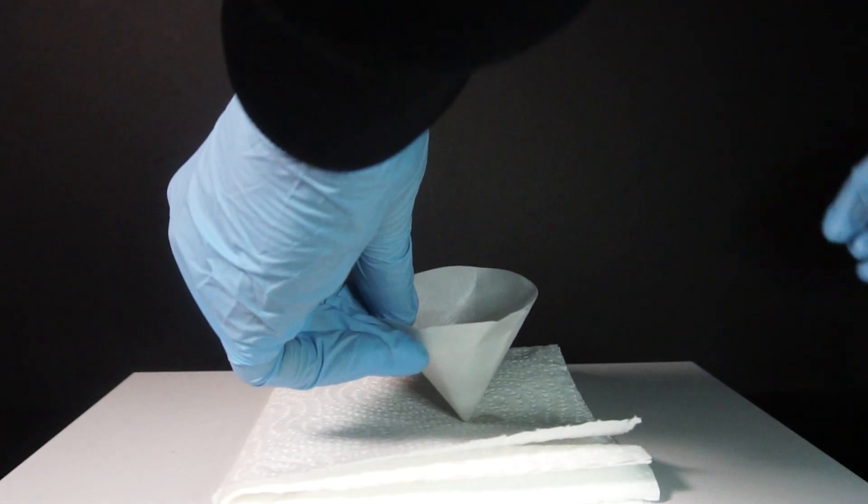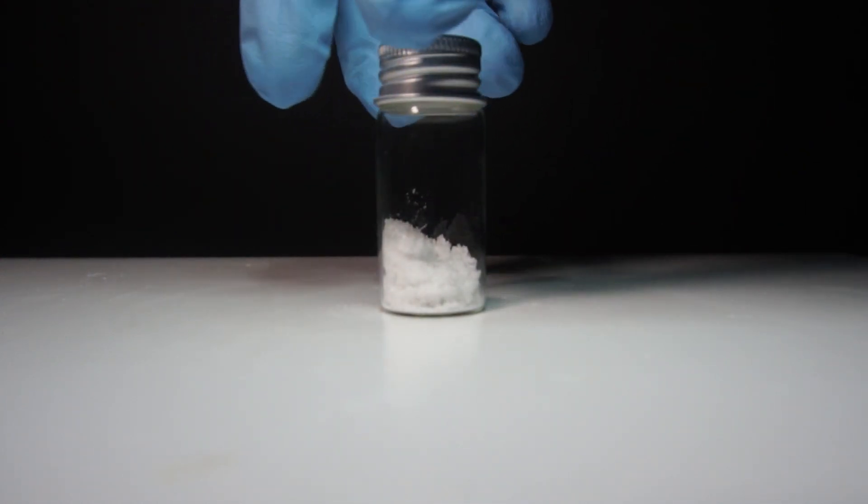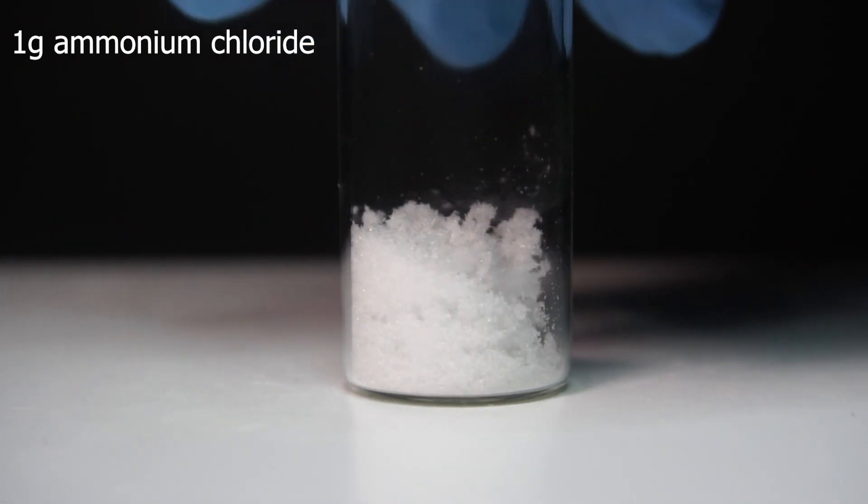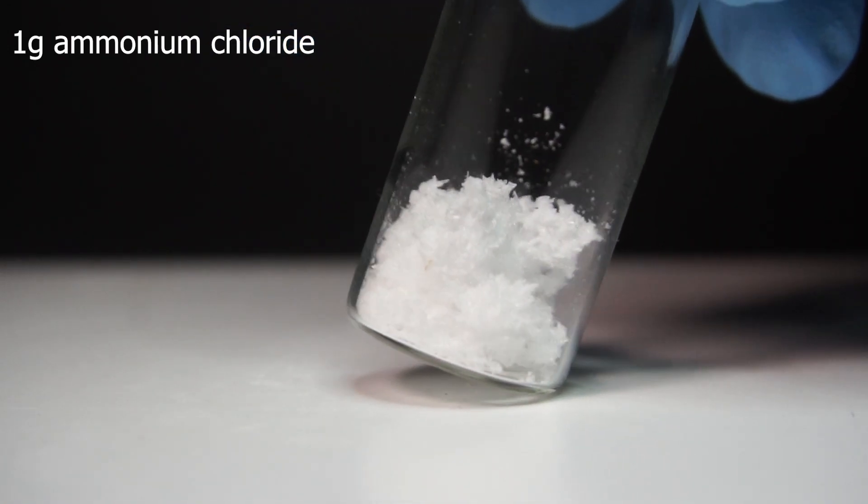In the end, I got around 1 gram of ammonium chloride and for my future project I need about double this so I will end up running this one more time at a larger scale to produce it.